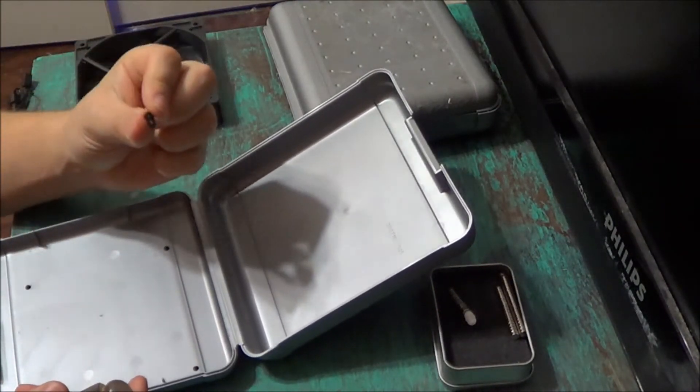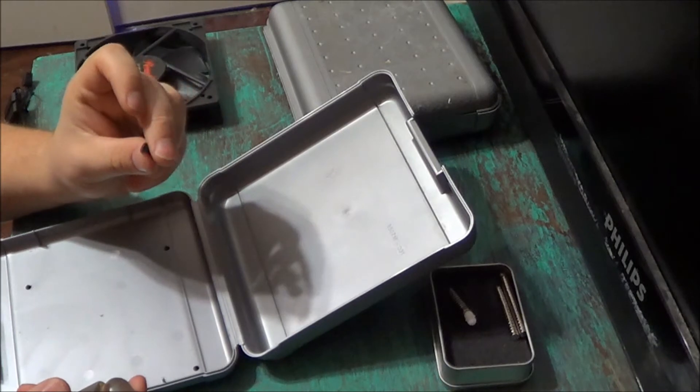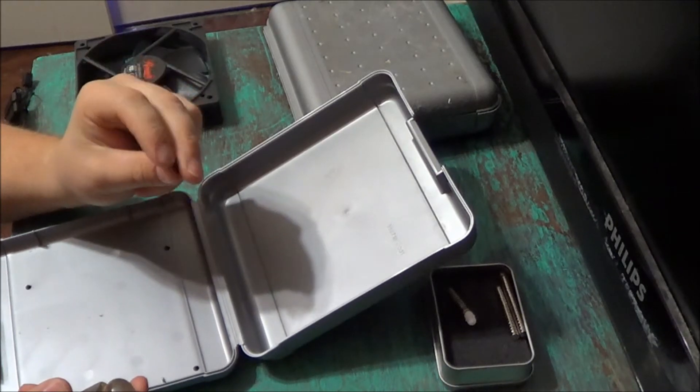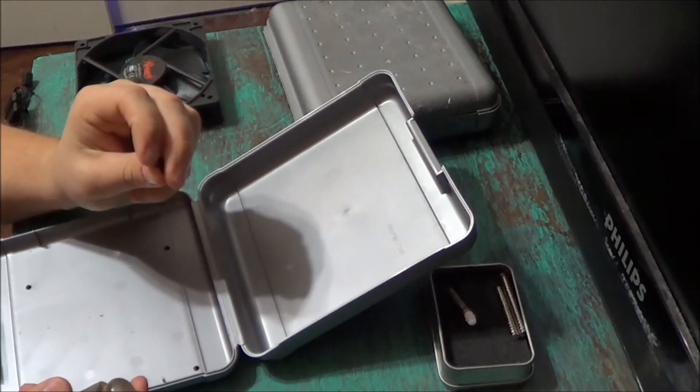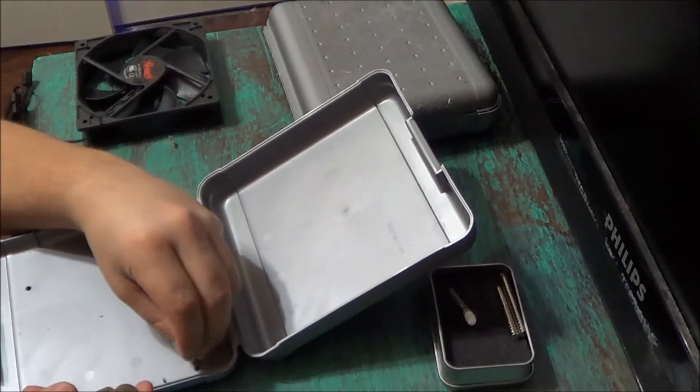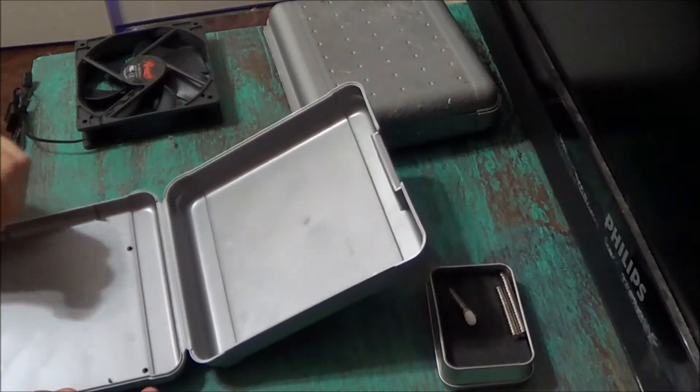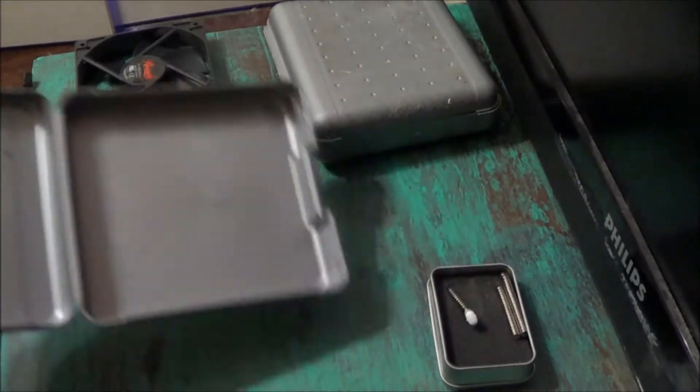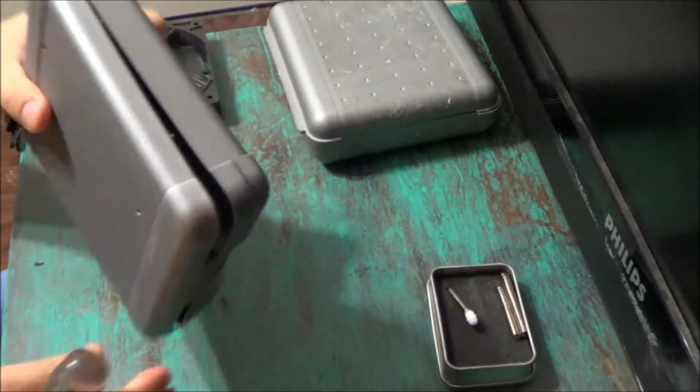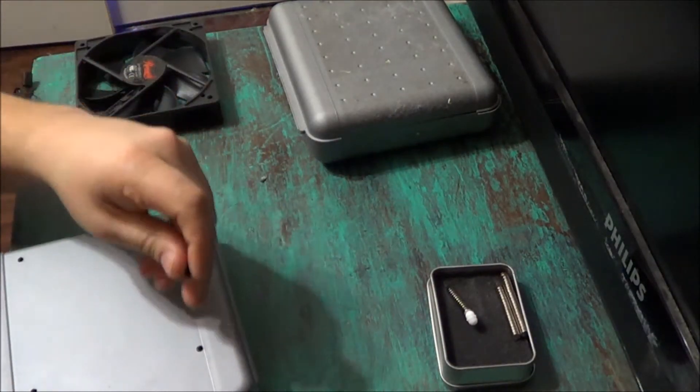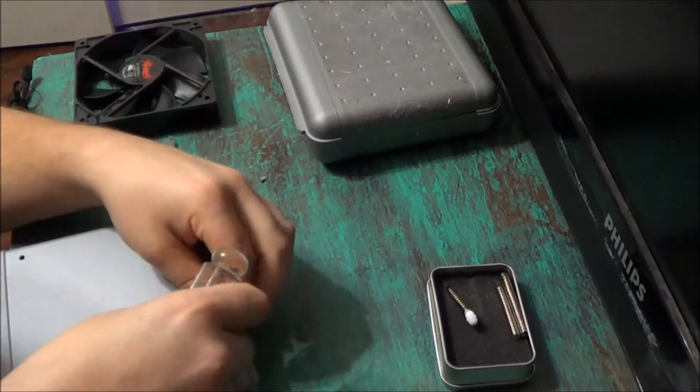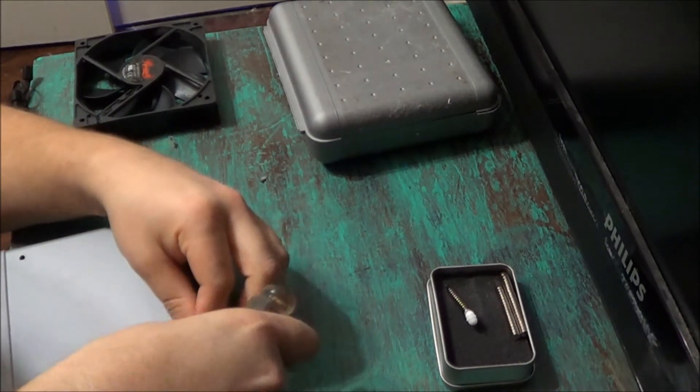Now I just want to run my screws through these since they were just a little bit bigger than the actual hole that I drilled, that way they'll be nice and snug. And being plastic, they will actually form their own threads through.